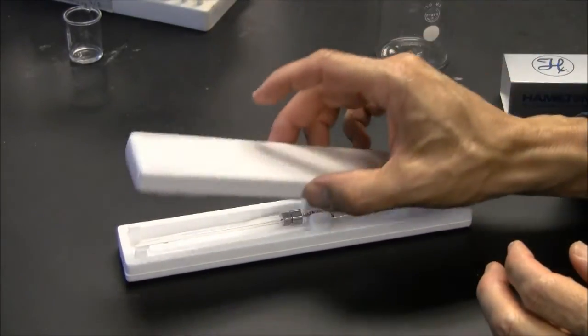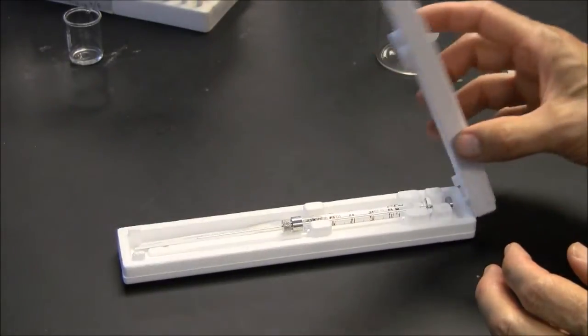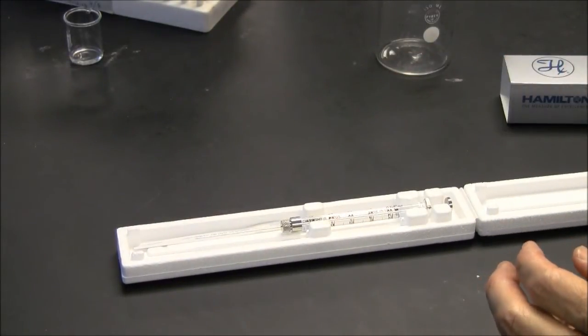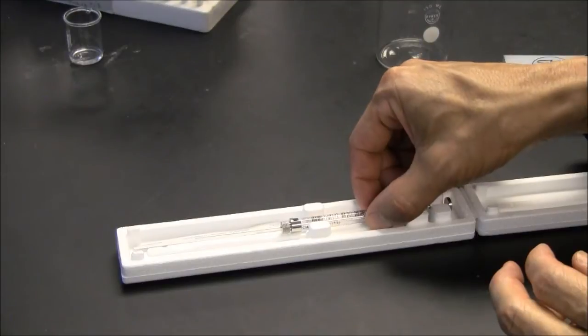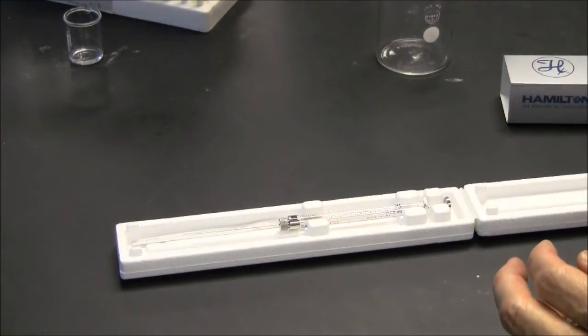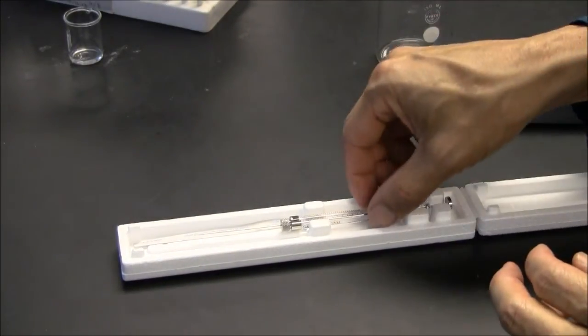If you treat this well, the syringe will be good for many, many uses. And if you treat it poorly, after the first use, it will be clogged. And that will be very upsetting.